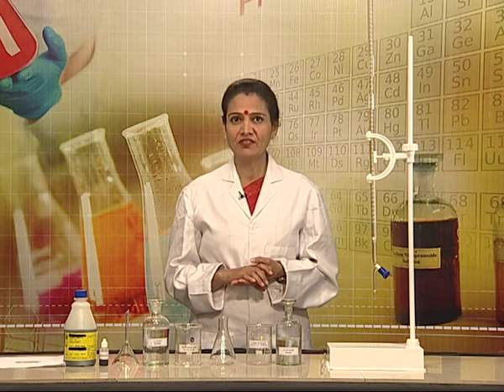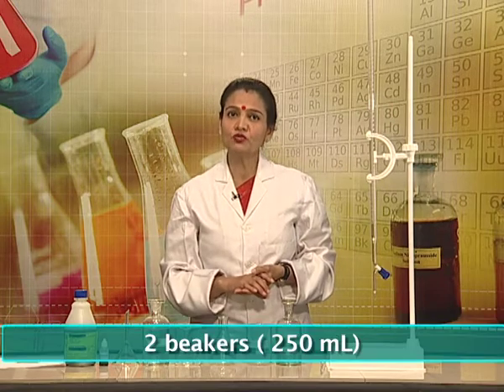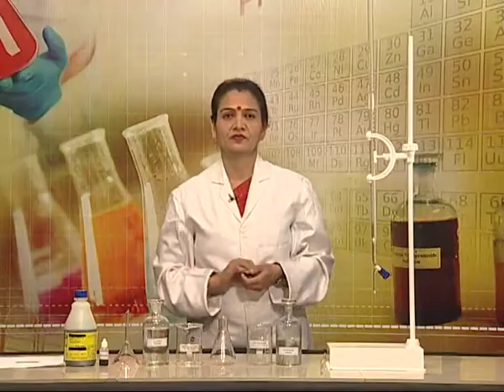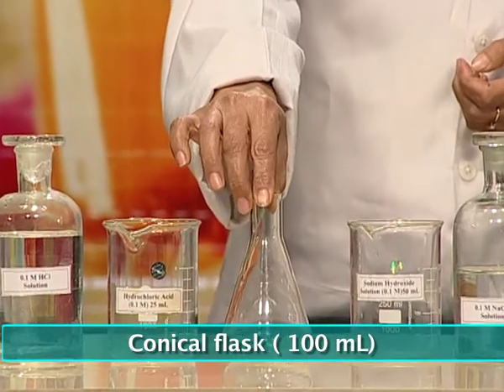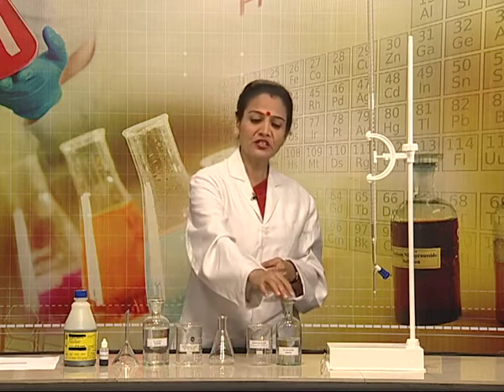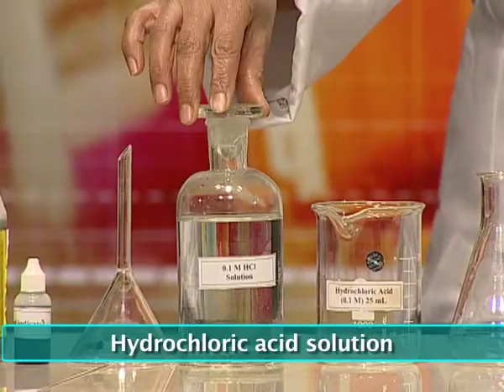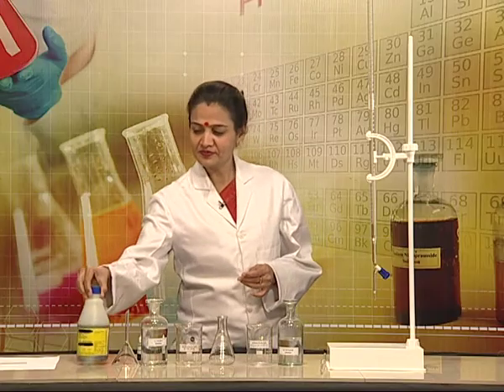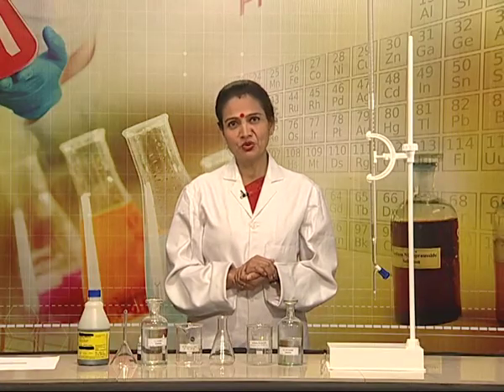For this, we have a burette, two beakers of 250 ml capacity, a conical flask of 100 ml capacity, a pH chart, two stock solutions — one is sodium hydroxide solution and another is hydrochloric acid solution — and universal indicator. And of course, one funnel. So friends, get ready to observe.